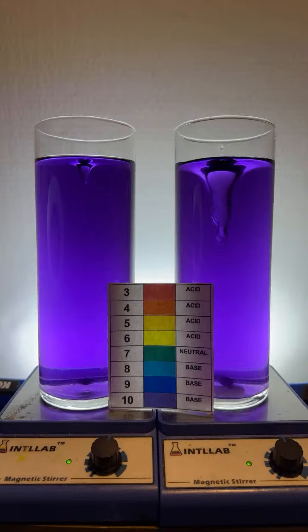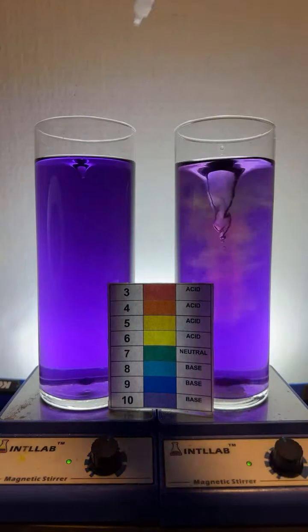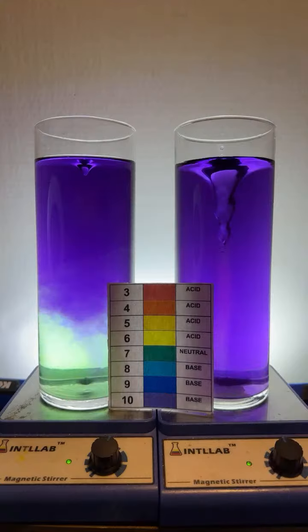We're just doing the experiment where I take universal indicator. It's also known as rainbow indicator. And I add that to some water in 2 flasks. Thank you there, Toon Boys. And then I just add acid or base, and you can watch what happens. And then we just talk. Okay, let's add a drop of acid over here on the right. Drop of acid over here on the left. You can see the red line going through there where the acid is.